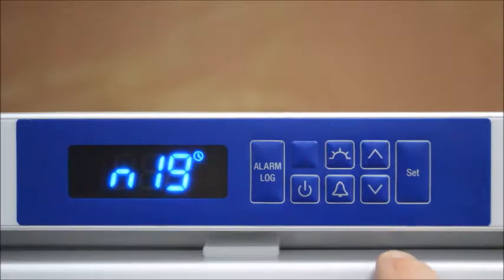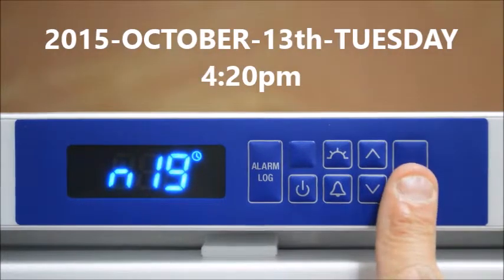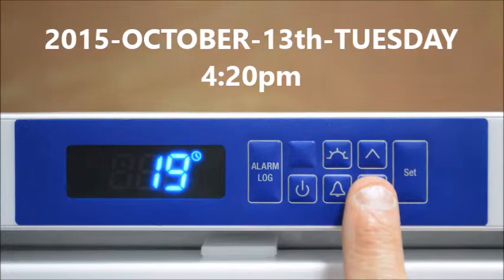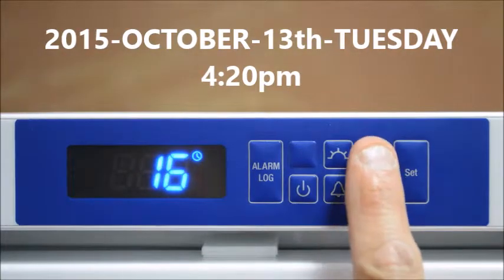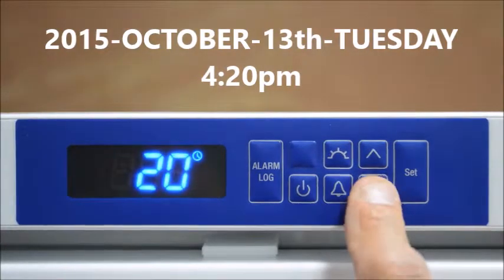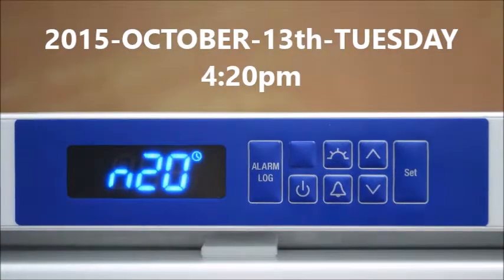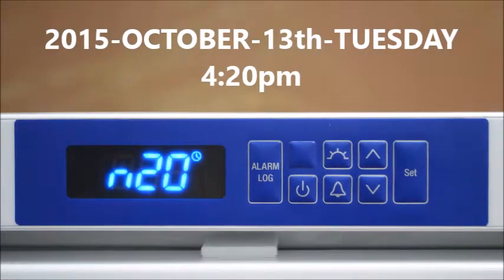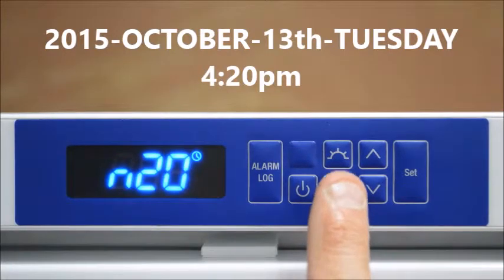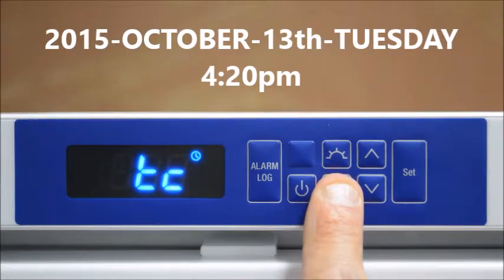By pressing the up arrow we can now change the minutes. We can then lock this into the memory by pressing and holding the bell.